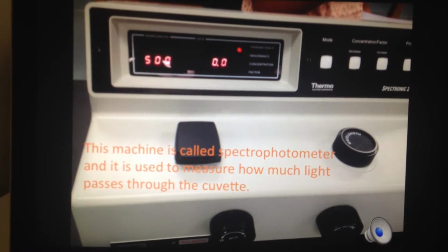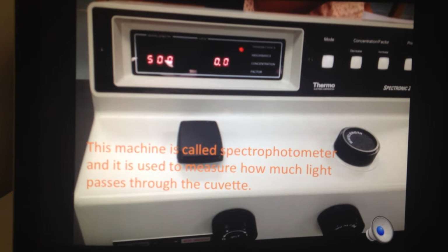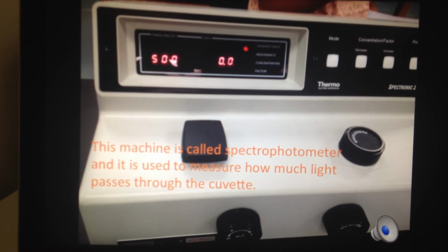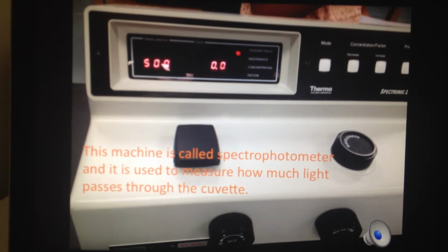As guaiacol reacts with the enzyme, the reaction darkens. As the solution darkens, the absorbance rises. By measuring the absorbance over time, we can measure the rate at which the enzyme reacts with the guaiacol.